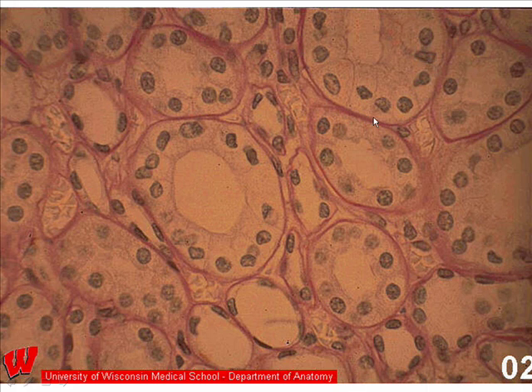The epithelial cells are polarized cells, as was discussed in the epithelial lectures, and having a base defines polarity for these cells. So here is the base of a simple columnar epithelial cell.